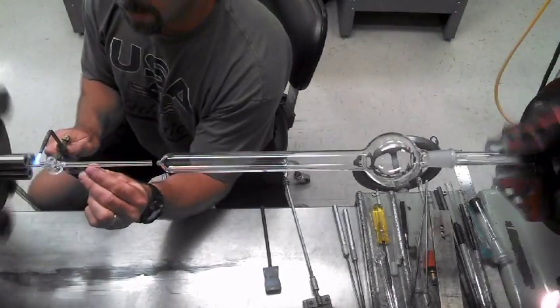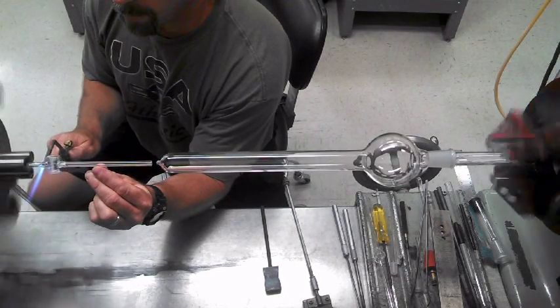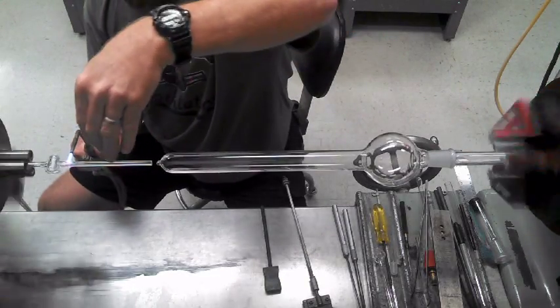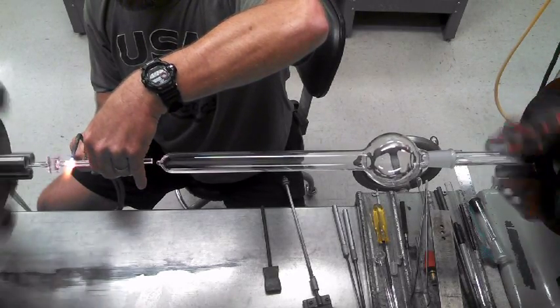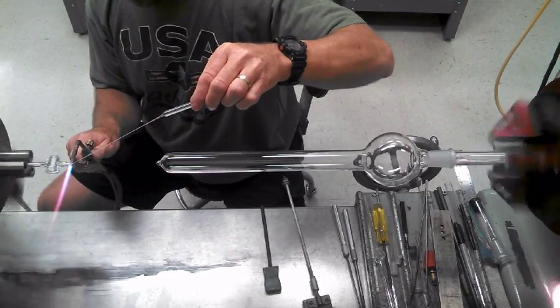Straighten the hot pot here. Now, this is tricky — watch this. I go to where I'm going to fire cut, where I'm going to fire cut here, and pull it off on the thin side, like this. Start right on the shoulder so it bends down to nothing.